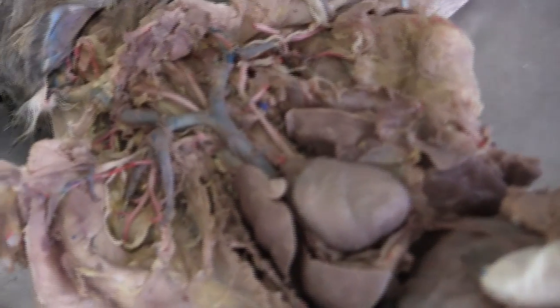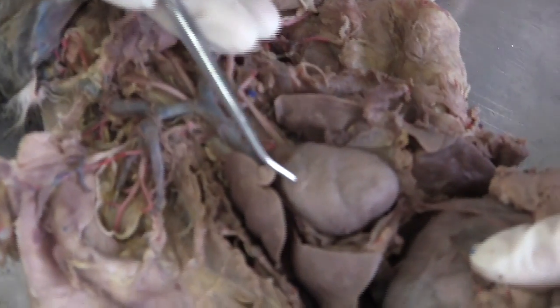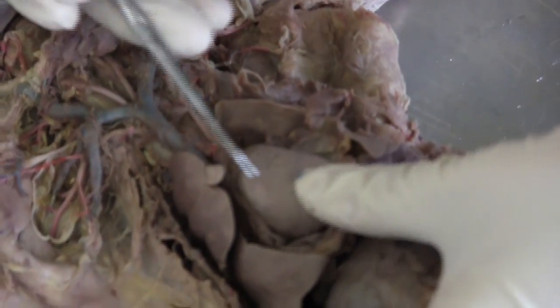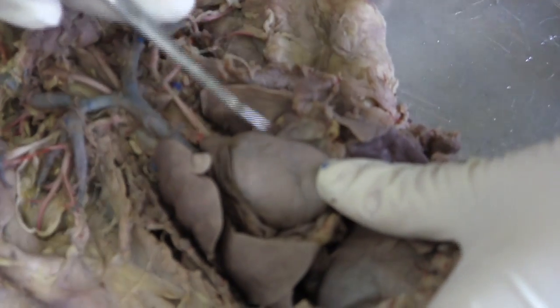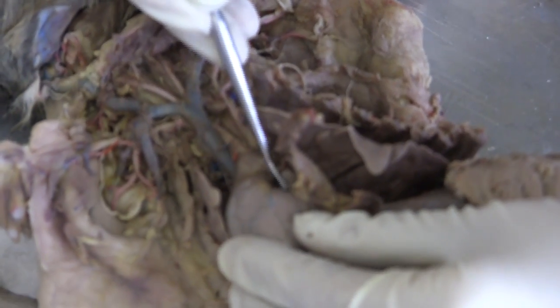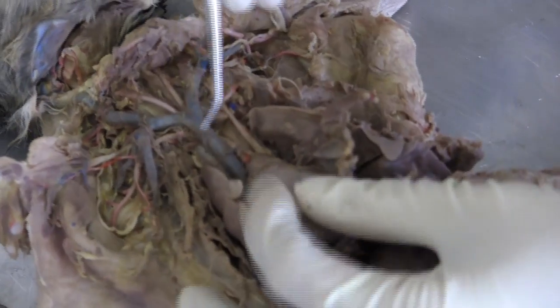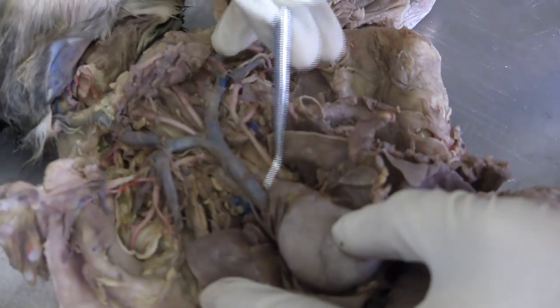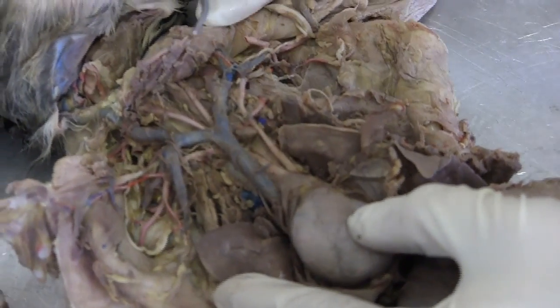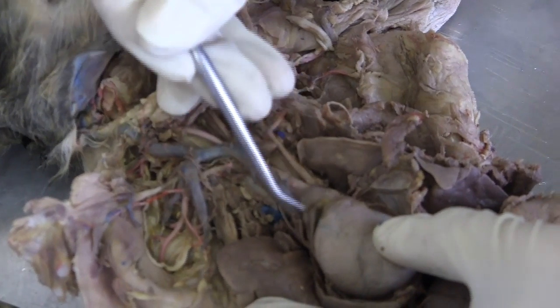The coronary artery is here — the fat stuff on the heart. You can see a little bit here; it's all on the heart. And the pulmonary artery is here. The ascending aorta is here, and the descending aorta and aortic arch are here as well.